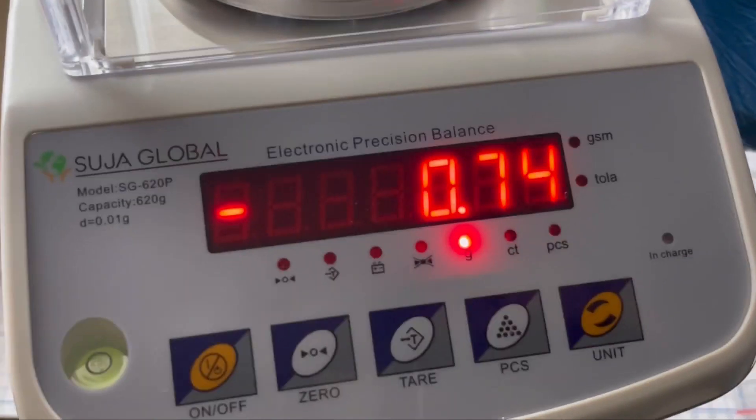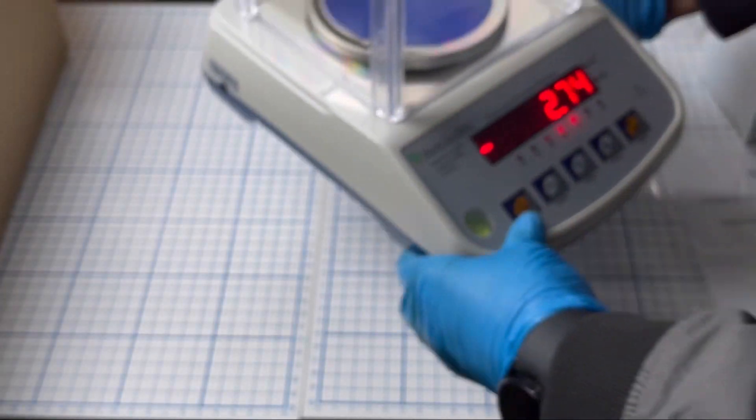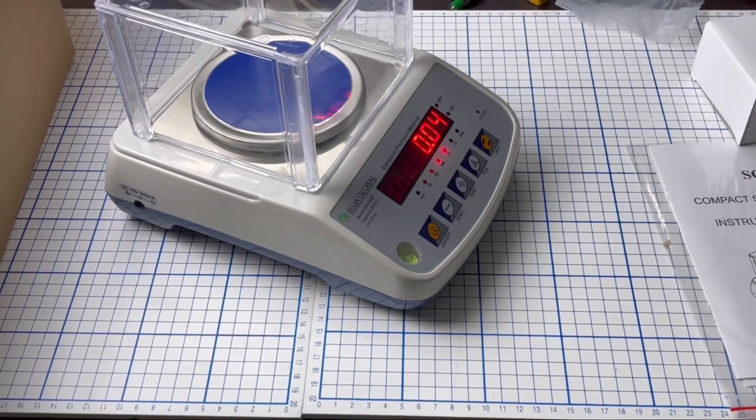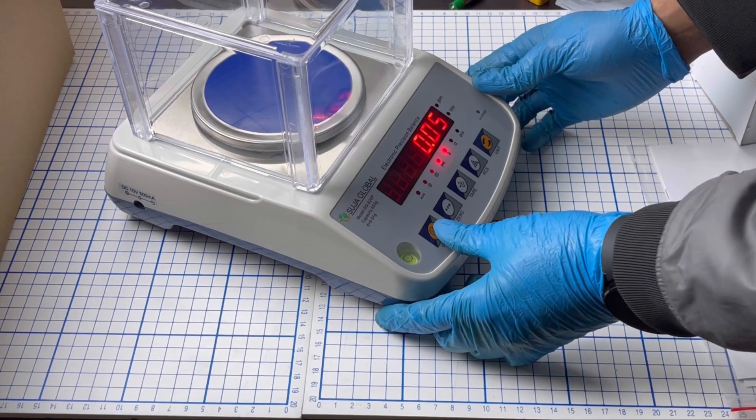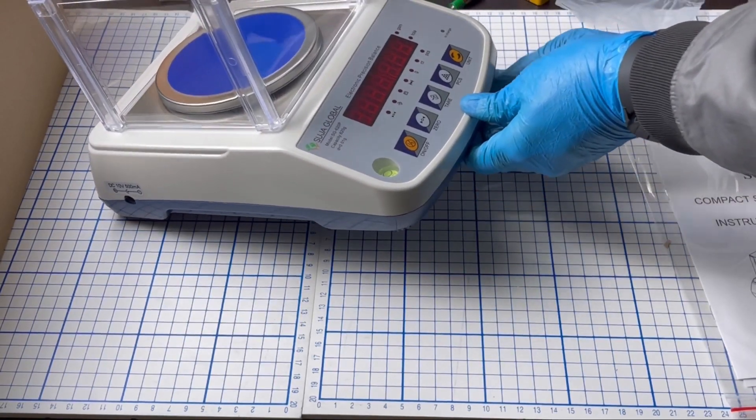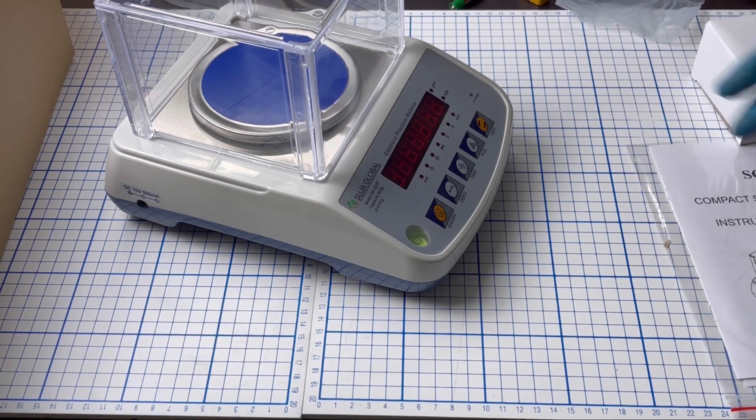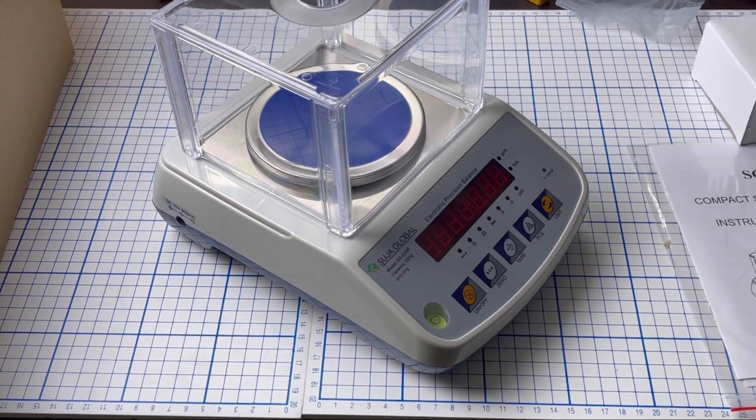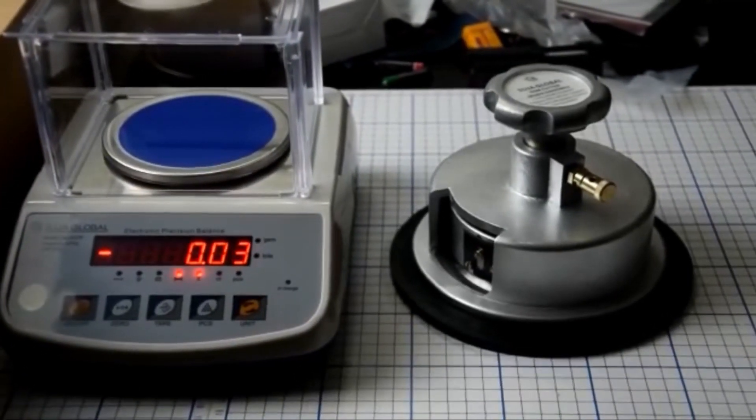Here is the machine. The display is blinking because of light, actually this is not blinking at all. My camera lumen is set so high, that's why it's blinking. You have to adjust the wheel under the scale.